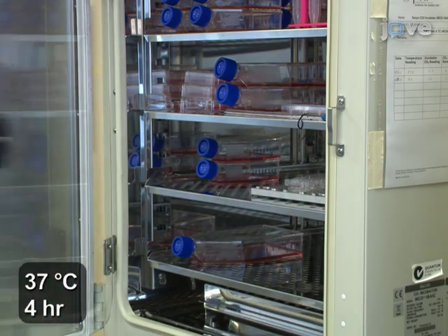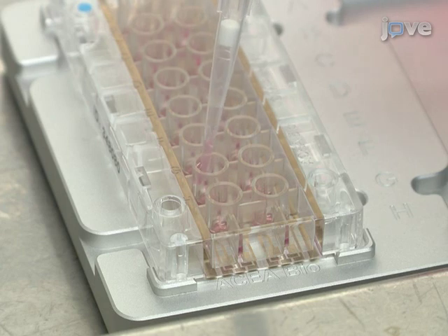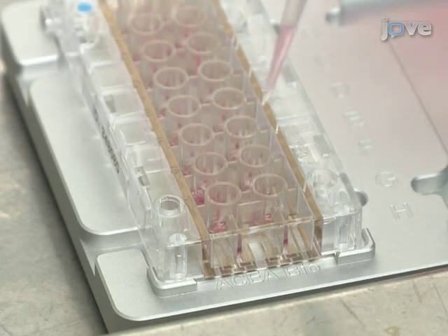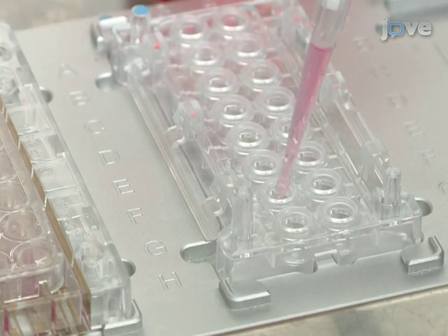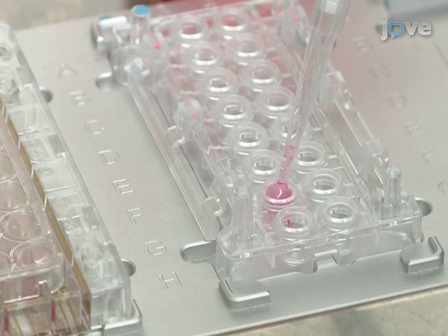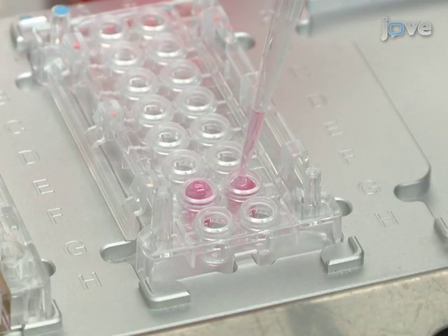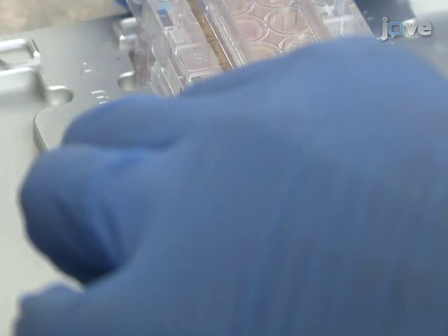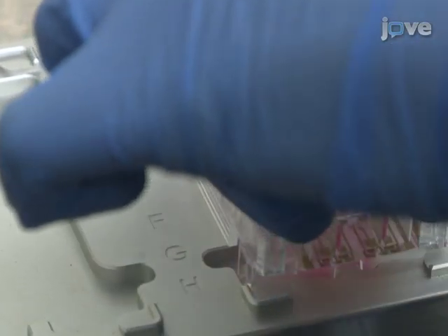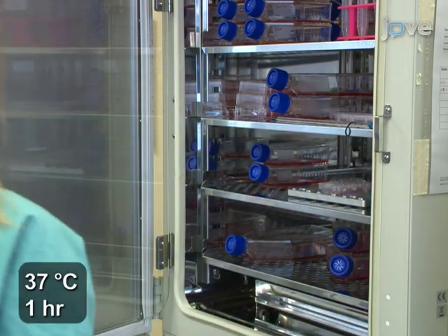Incubate the plate at 37°C for four hours prior to use in a tissue culture incubator. After four hours, add 30 microliters of serum-free medium appropriate for each cancer cell line to the upper chamber, and 160 microliters of media with or without serum as per the experimental design to the lower chamber. Assemble the CIM plate by clicking the lower chamber into the upper chamber and equilibrate in a 37°C incubator for one hour.